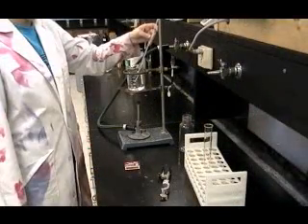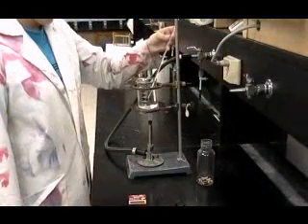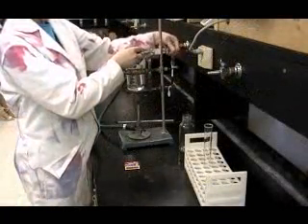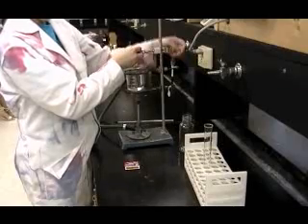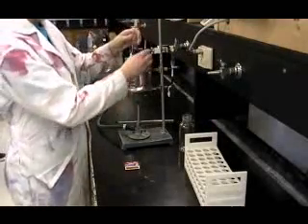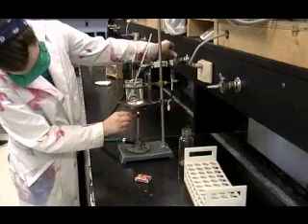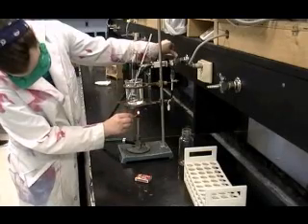After preparing the reaction mixture, you will need to monitor the temperature of the water bath until it reaches 70 degrees Celsius. At that time, turn off the gas and place the test tube in the 70 degree water bath and hold the temperature at 70 degrees for 15 minutes while the reaction proceeds. It may be necessary to relight the Bunsen burner to maintain the 70 degree temperature for the water bath.